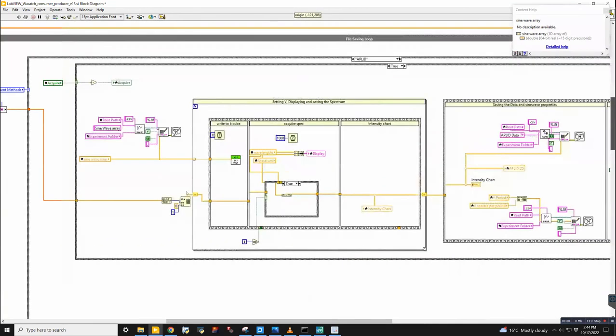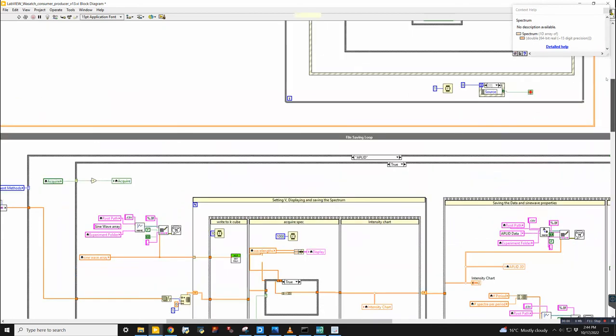So if we come back up here, which is where we started, we have this sine wave array. And for every value here, we're going to execute this whole frame. So we initialize a blank array, which has the size of a spectrum, but no elements in it. So it's just like a pre-allocated array. And what we do is first write to the K cube. And then we take a spectrum, which is passed in from here.